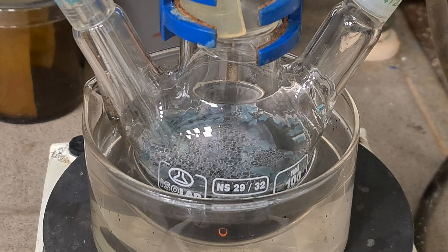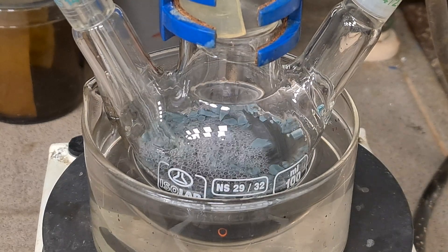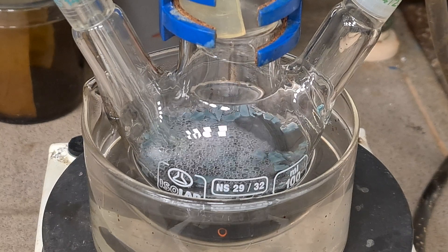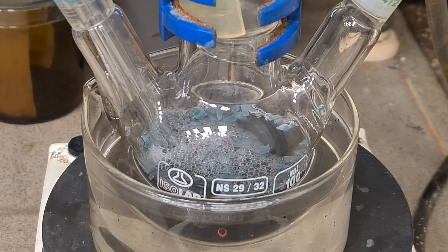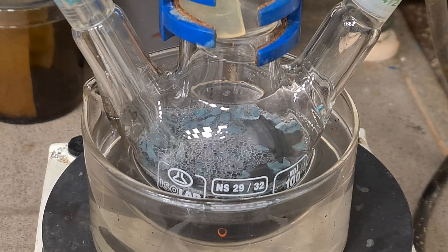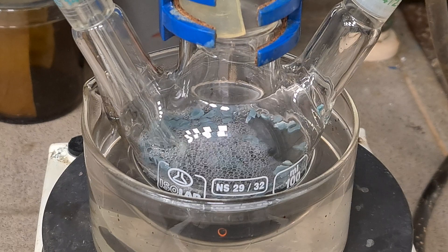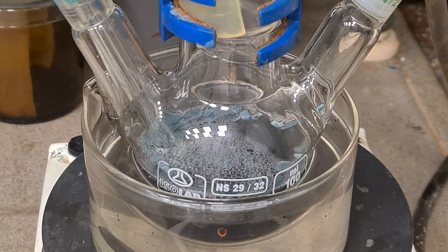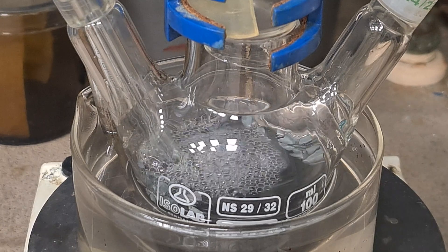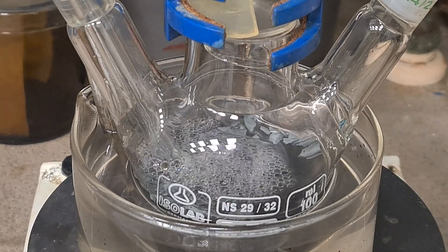Then close it with a stopper for 3 hours. Due to the covalent character of the final product, we could probably say that we are dealing with a lithium organic. You may notice that lithium pieces look covered by mold, but actually it's blue — this color is due to alkali metal electron solvation in THF. After the time is up, lithium metal becomes shiny; let everything cool down.